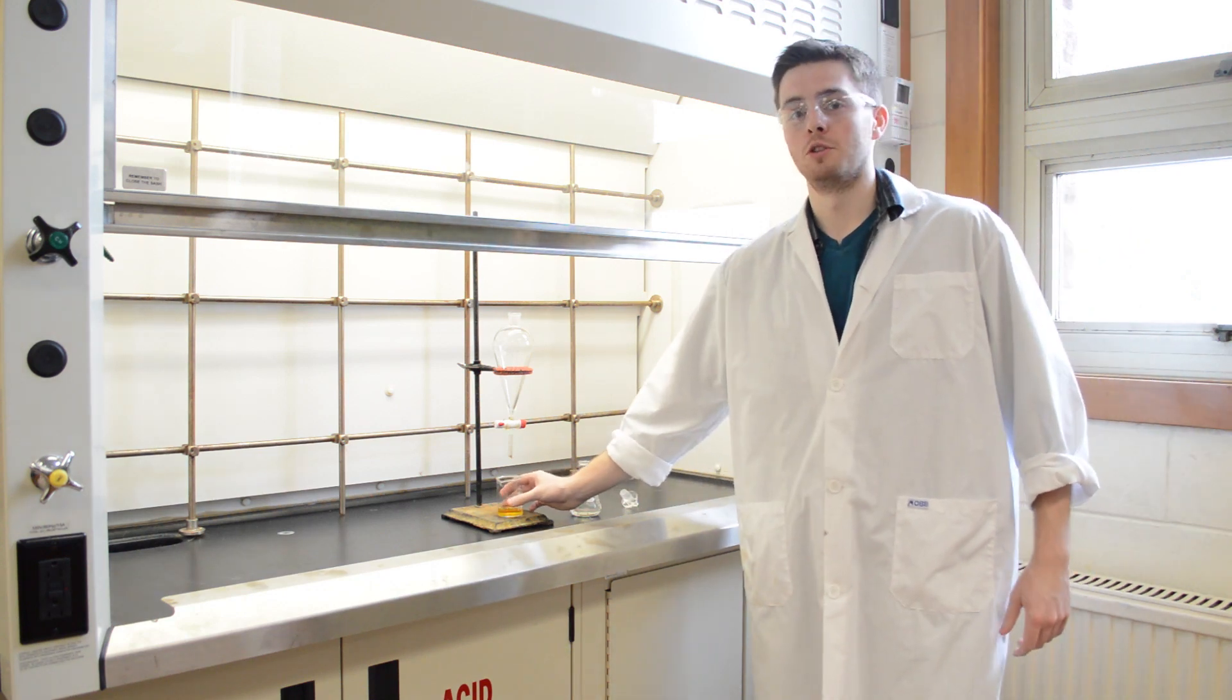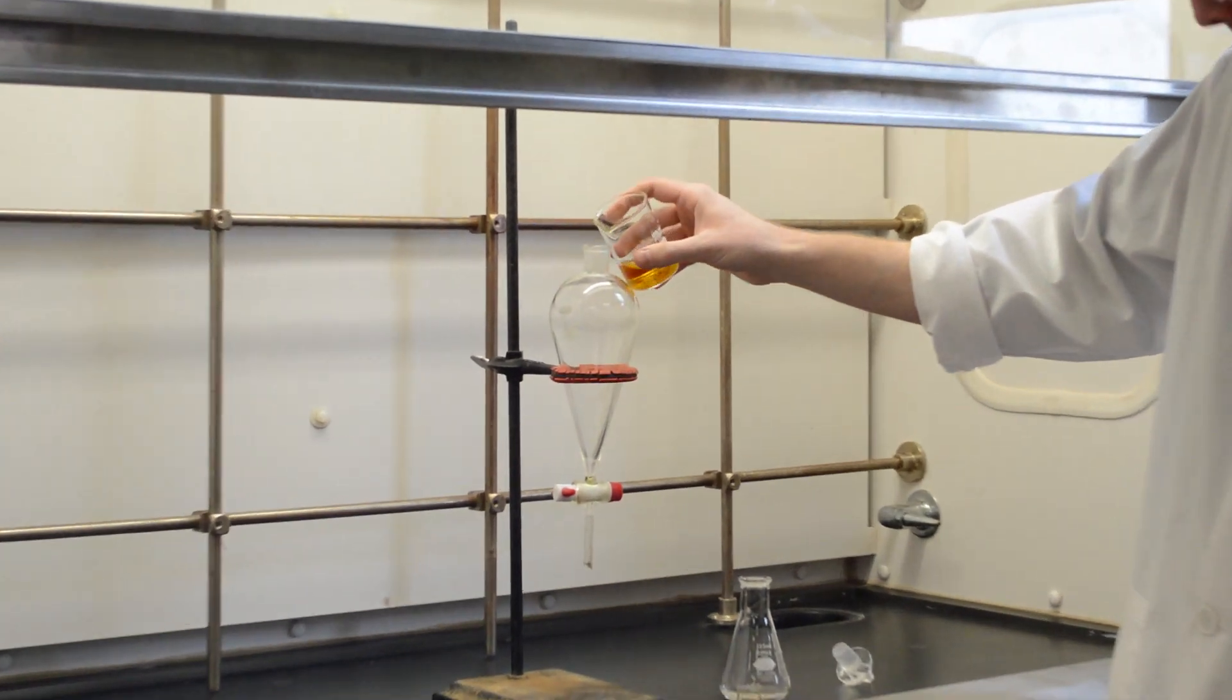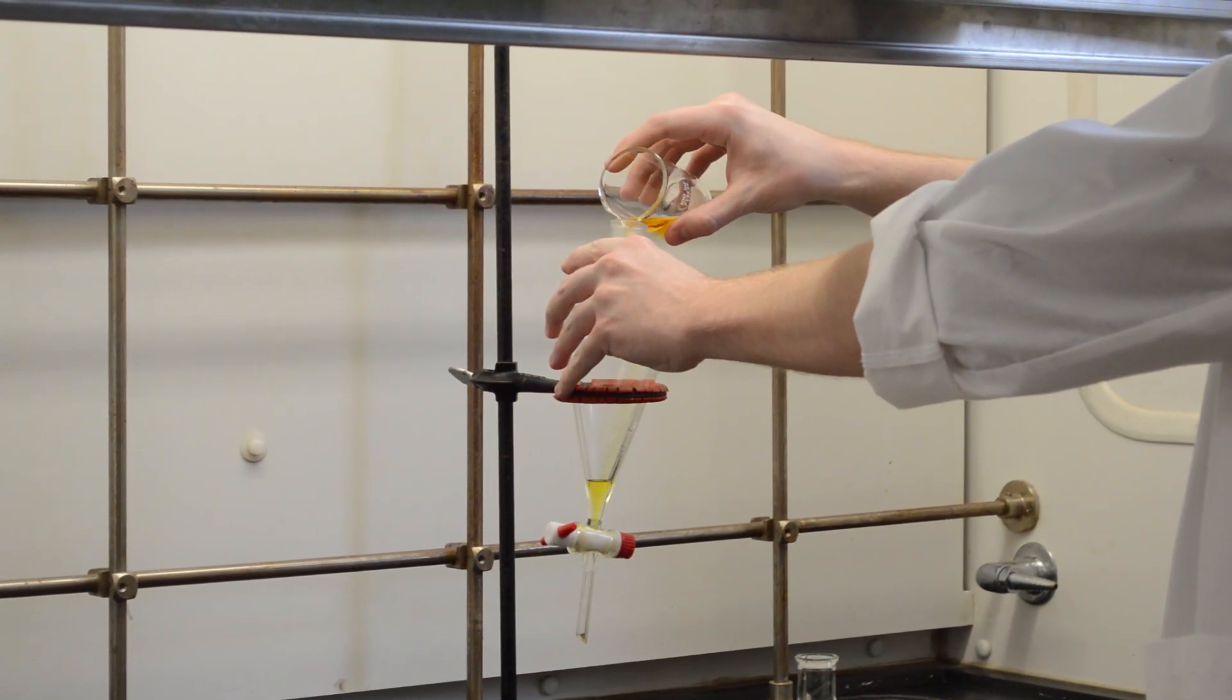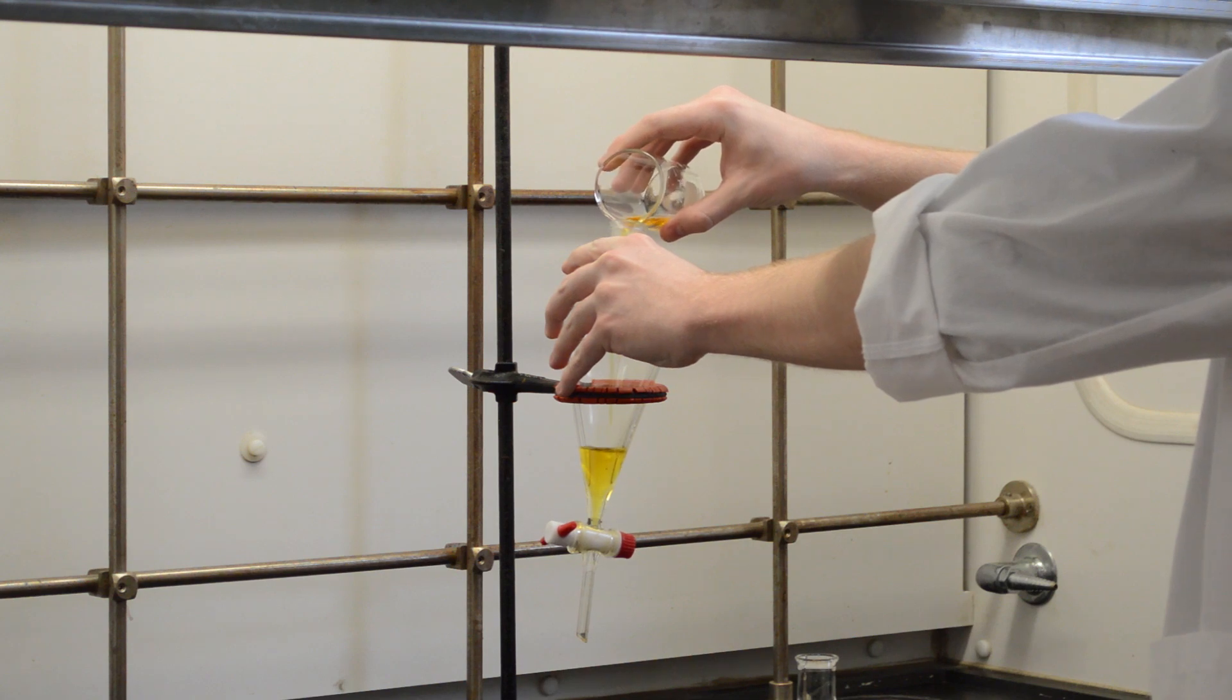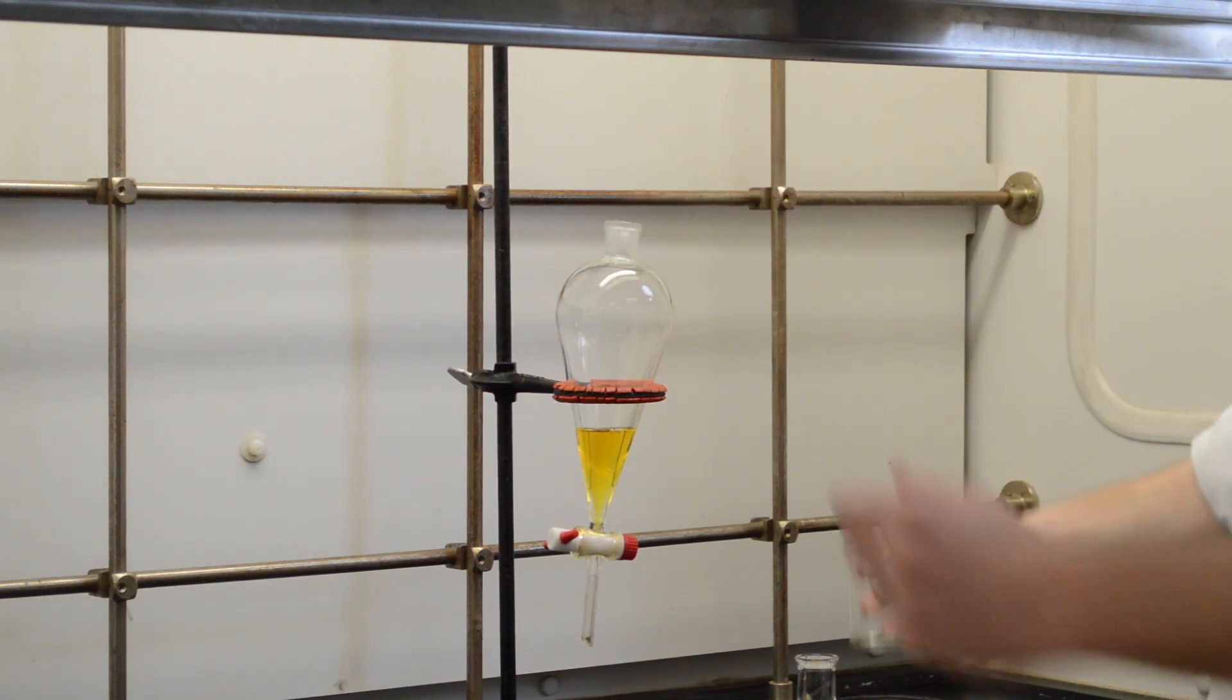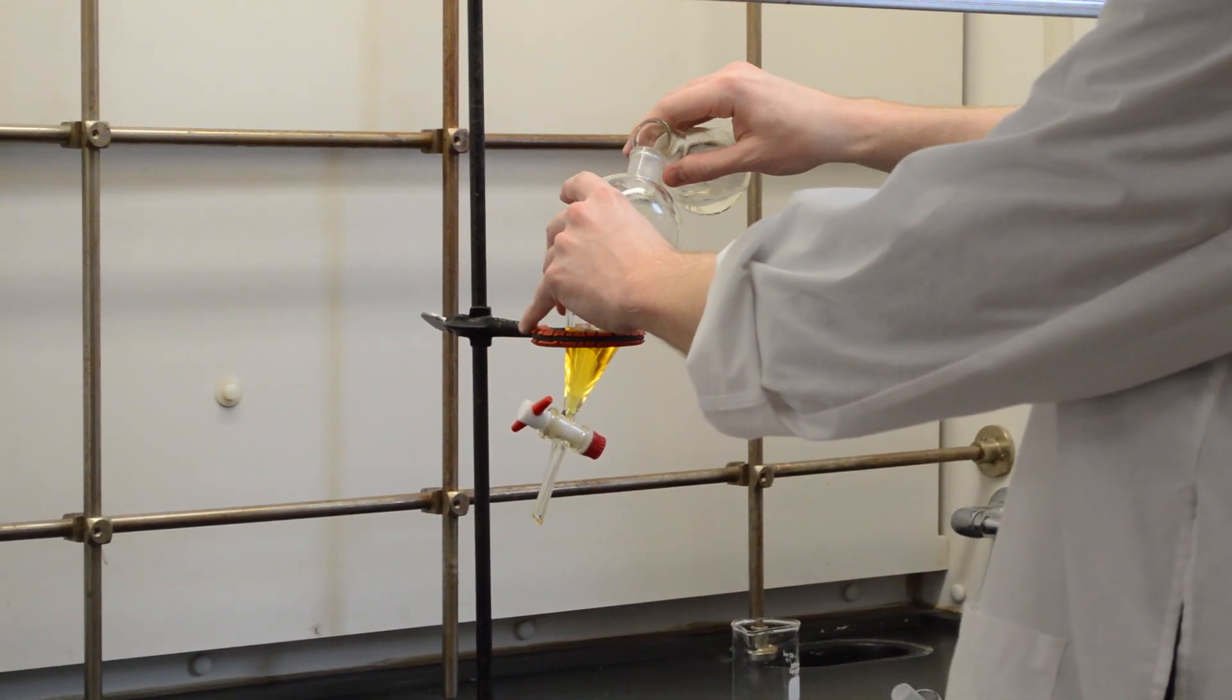Once you add the two solutions you can pour each into a separatory funnel, and you want to make sure that this is closed so it doesn't pour right out. When pouring your second solution in you want to make sure you pour it gently so that it doesn't splash everywhere.